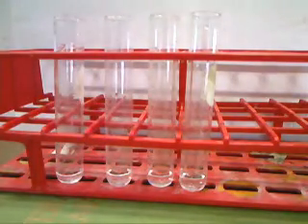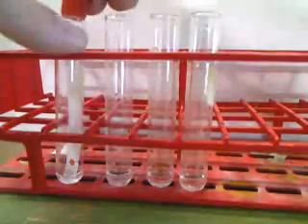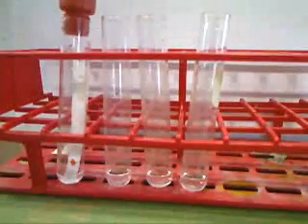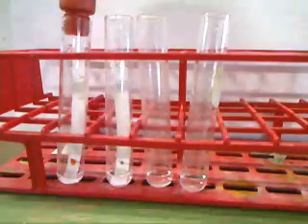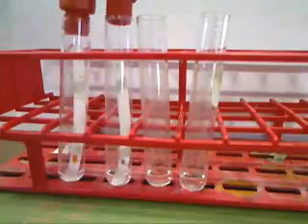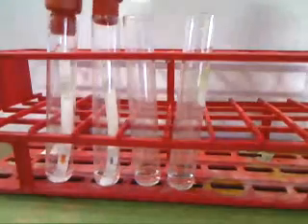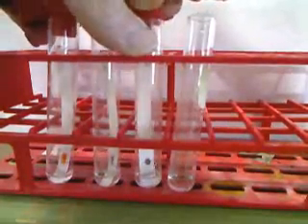So we have our test tubes, each with water at the bottom, and we're now going to put each of our strips into the test tubes and let the water begin to move up. After we drop the strips in, we'll seal the top so all the water doesn't evaporate, and then we simply have to wait and see what happens.